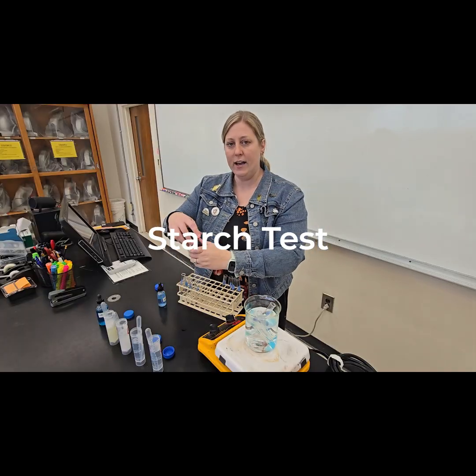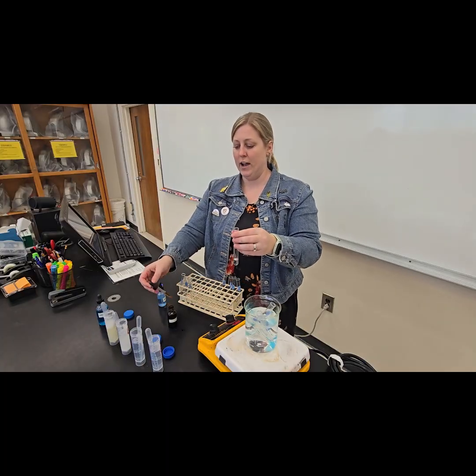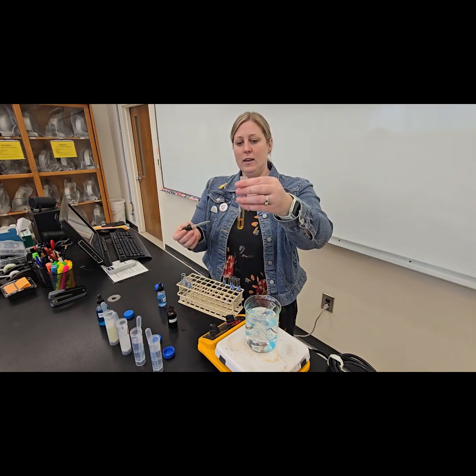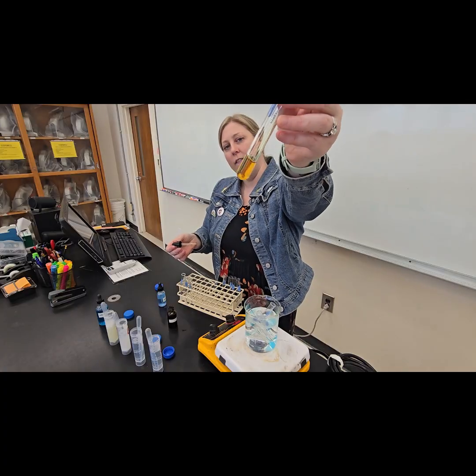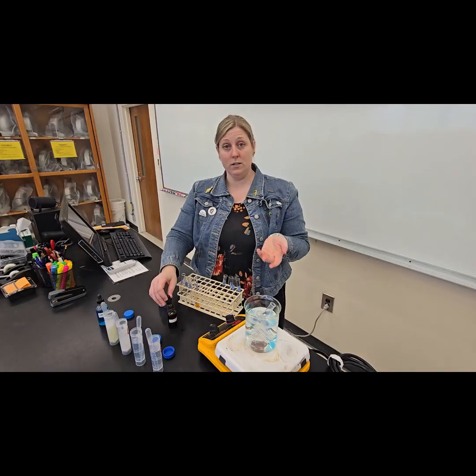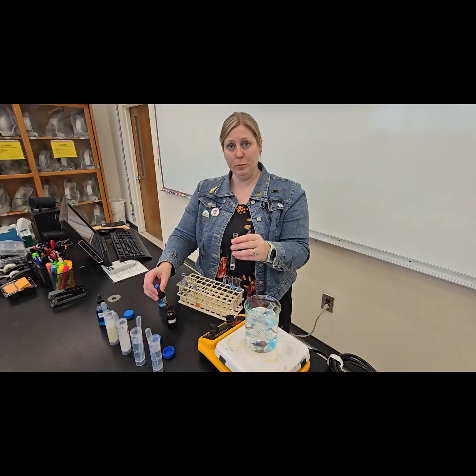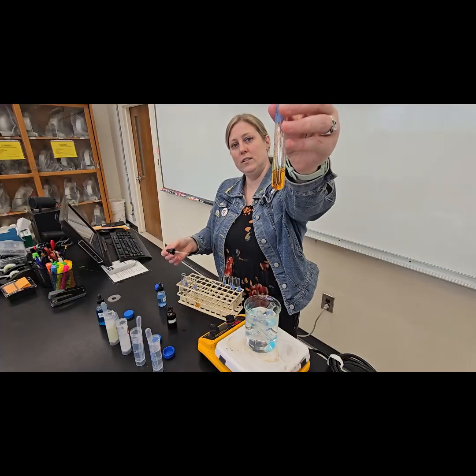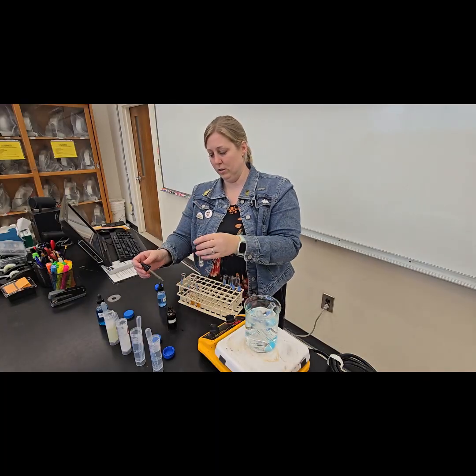So once I add the iodine to these test tubes, we should see a very quick, immediate reaction. So my iodine in my dropper, I have my distilled water, and no reaction. It stays that kind of tea color, that kind of off yellow brown, which is expected because distilled water shouldn't have anything in it. Glucose is a simple sugar. It is still a carbohydrate, but we should not see a response with glucose. Good, no response for glucose.